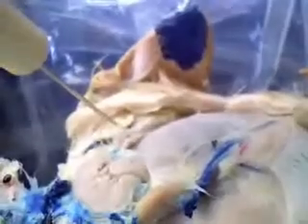I'm going to first start with the salivary glands. Now over here beneath the ear, this is the parotid gland right here. And connected to the parotid gland is the duct of the parotid salivary gland that passes over the masseter muscle. Unfortunately, I believe I must have cut it off on both sides here, because I don't see it over here and I don't see it over here.